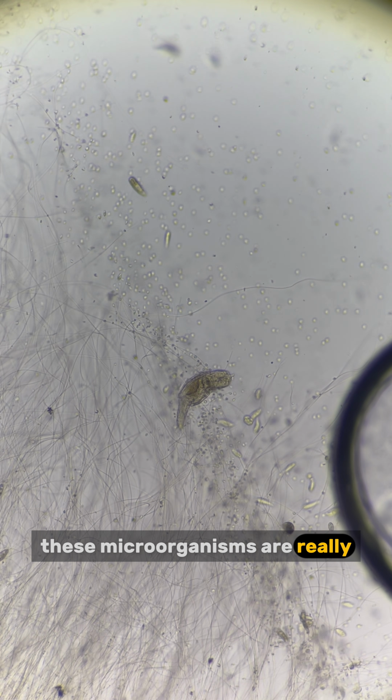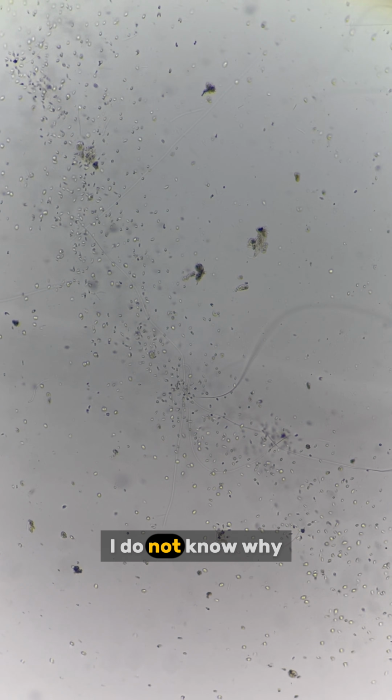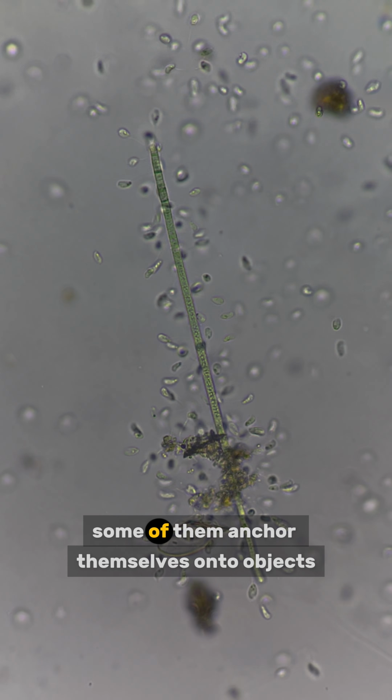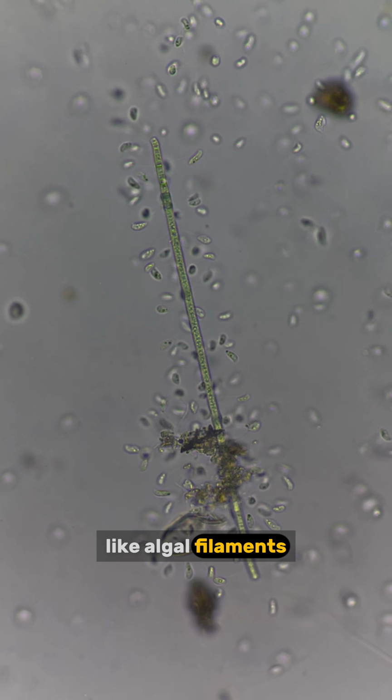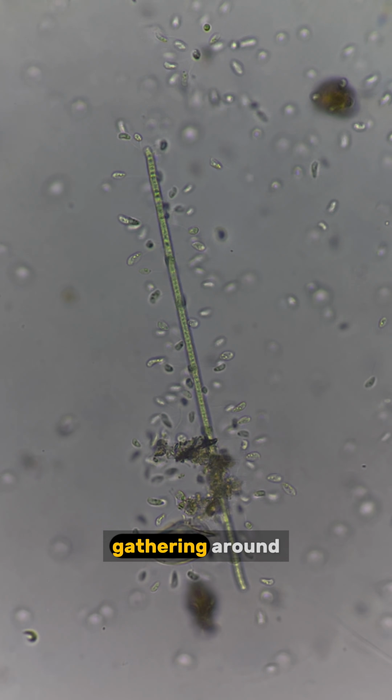These microorganisms really like living inside fungal hyphae. It creates spaces for them to hide and gather. I do not know why they gather and form something like a path, as if they are guiding us somewhere. Some of them anchor themselves onto objects like algal filaments. These small ciliates are blooming in the sandbox. It makes me think of a group of mosquitoes gathering around.